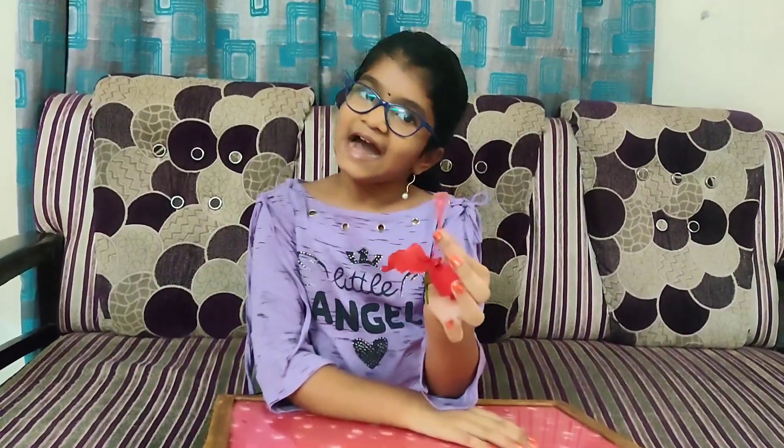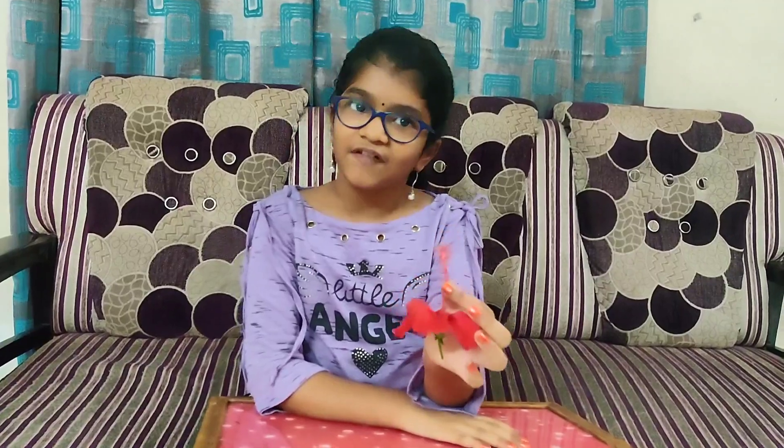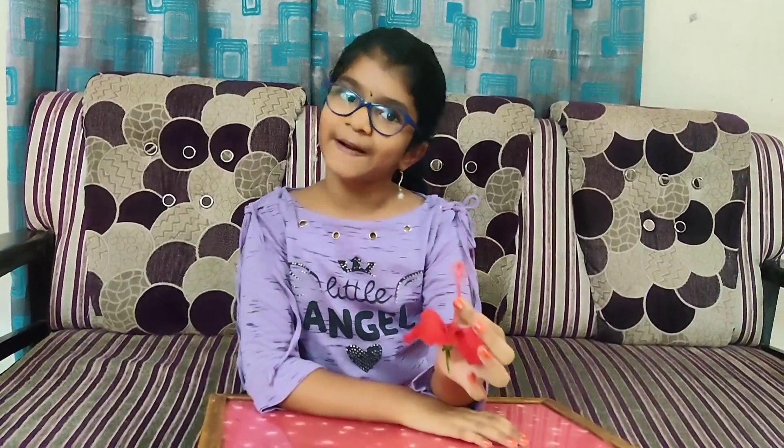Now, I am going to dissect the flower to show each part.